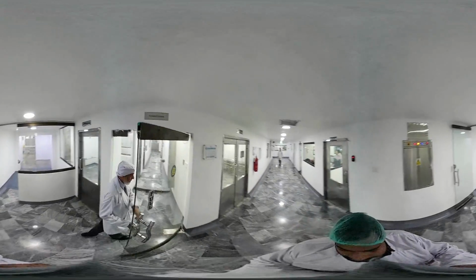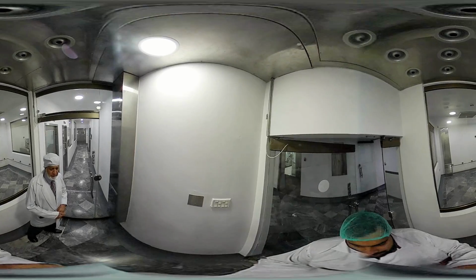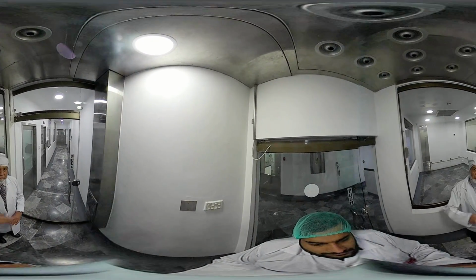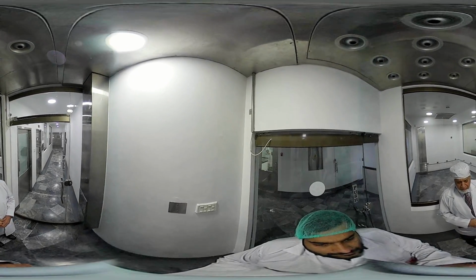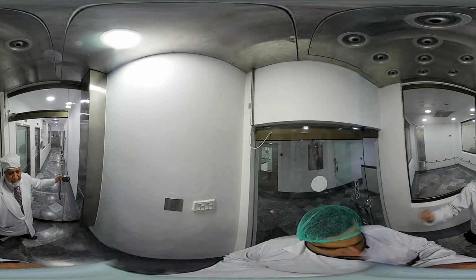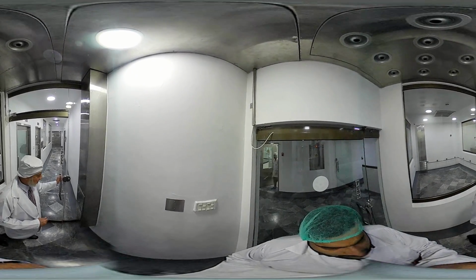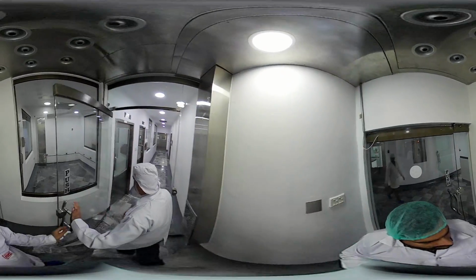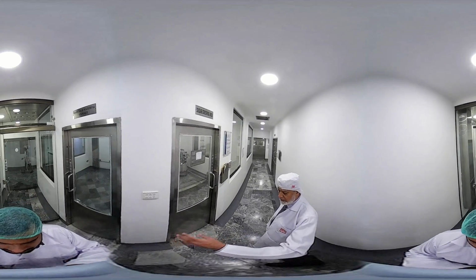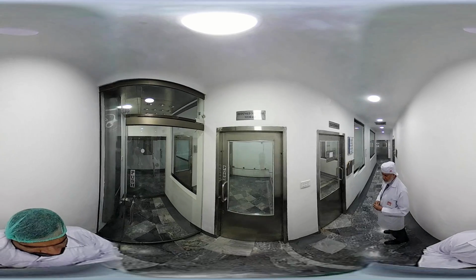What we do now, this is a buffer zone, because we are entering from the external corridor into the main functional area. We have a purified flush air system, and this is again a double door system. If the external door is open, the other cannot be opened because of the interlocking system. So we move into this area, and on our left, as I was telling you, is the storage room for the production activity.